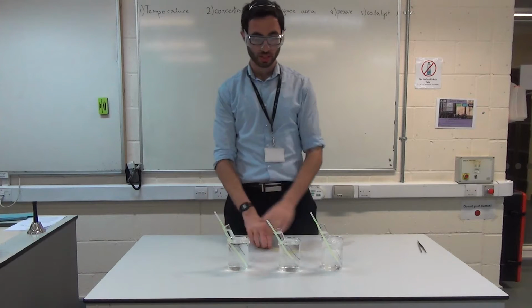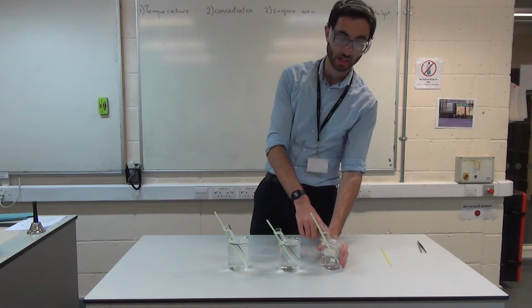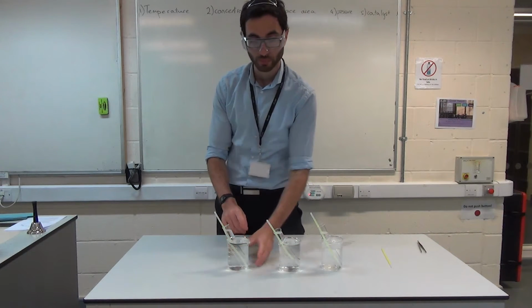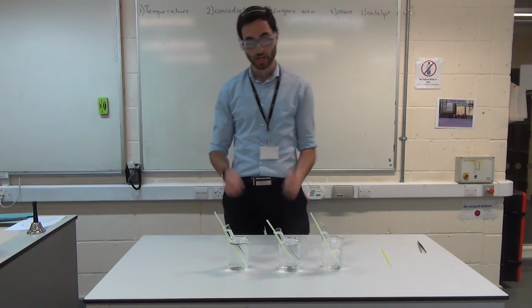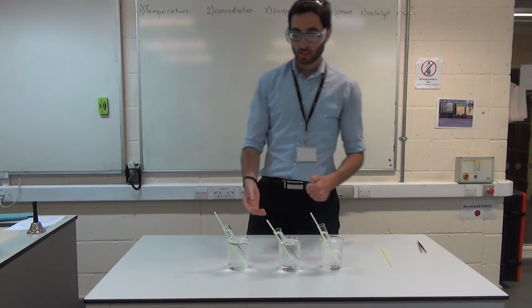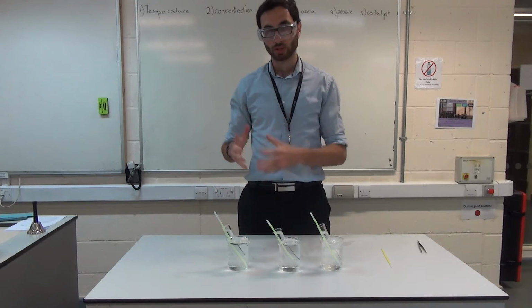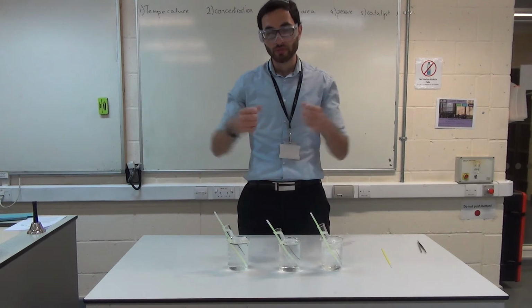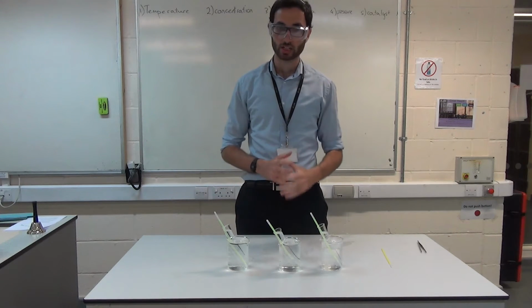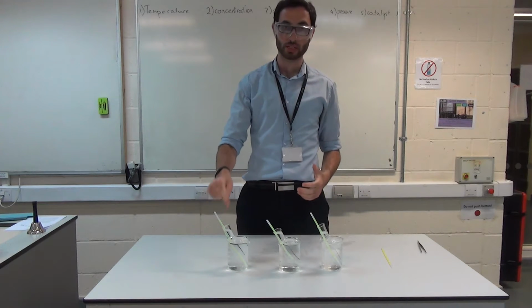I've got 3 different glow sticks here which have all been sitting there getting used to the temperature that they're in. I've got one that's set in an ice bath, one that's at room temperature, and one here that's in boiling water. What I'm going to do is I'm going to crack them all, shake them up, and pop them back in. What you should see is that the rate of reaction is much quicker in the one that's really hot. Now, if every time a reaction happens it releases a little bit of light, if there are lots of reactions taking place, we're going to release a lot of light. So you should see that this one's the brightest.